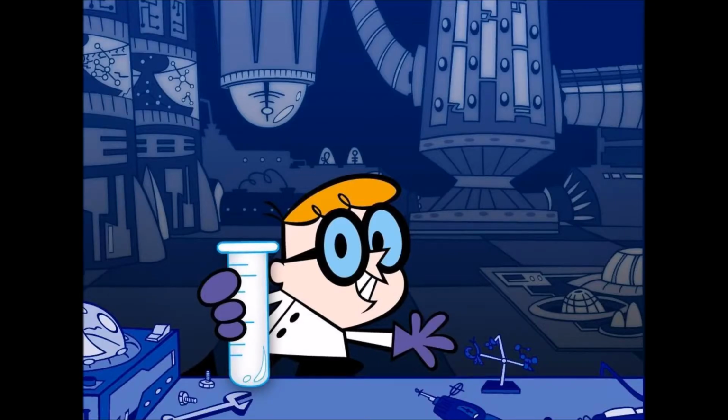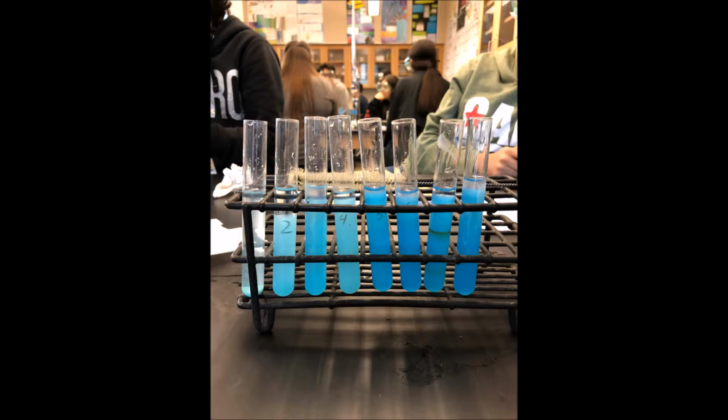The purpose of this lab was to observe the transformations that occurred when different ratios of potassium hydroxide were added to the 5 milliliters of copper sulfate 8 separate times to see a different reaction based on different amounts of reactants in the 8 test tubes. Then, we measured the precipitate with a ruler.